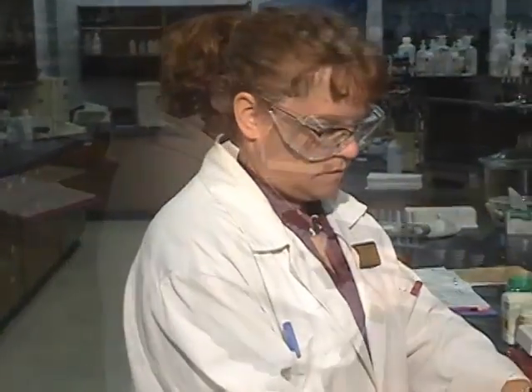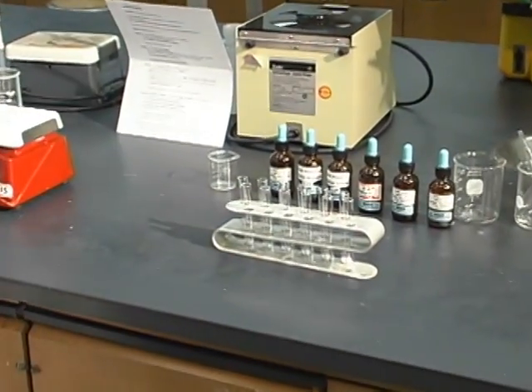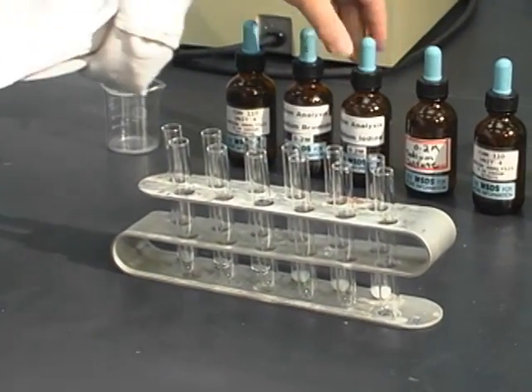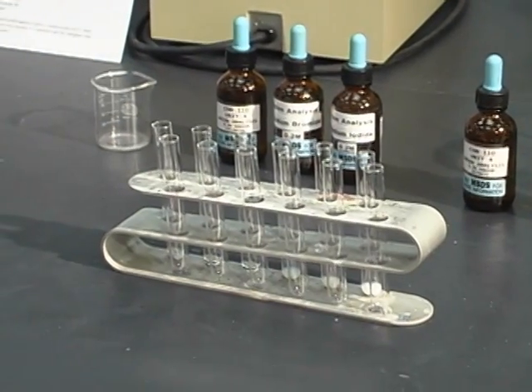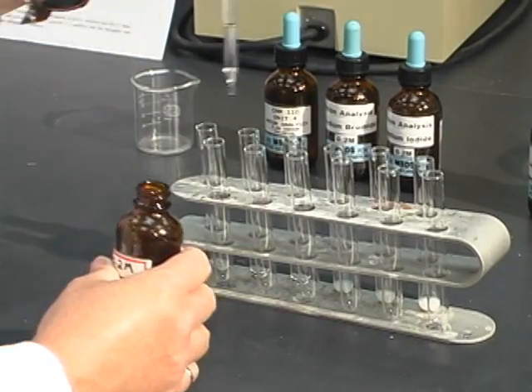Now we're going to continue and analyze for each of the ions specifically. First we're going to test for sulfate — I'm going to put about five drops of my known solution into the test tube.